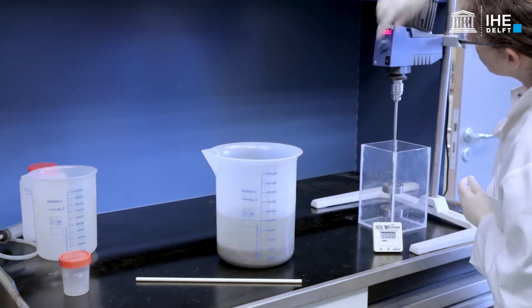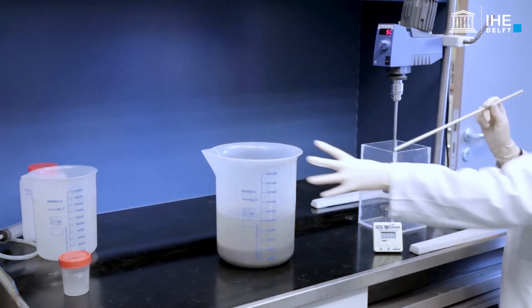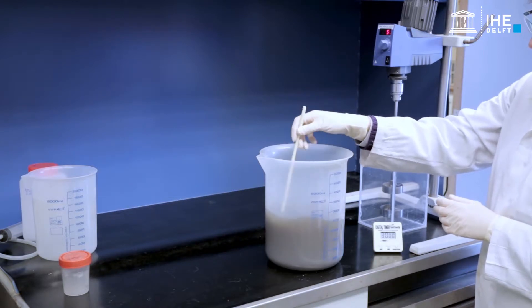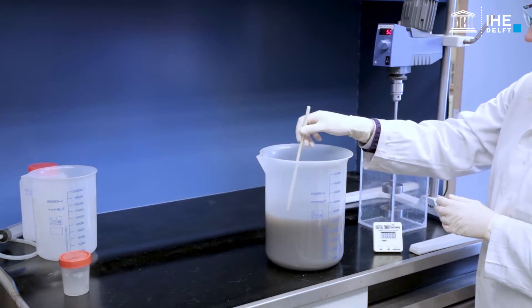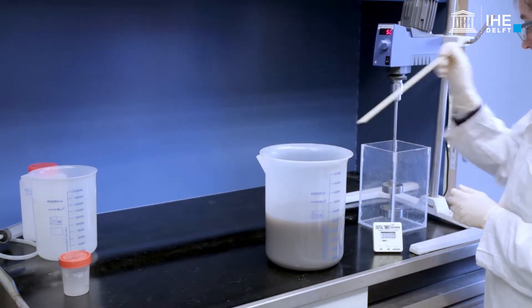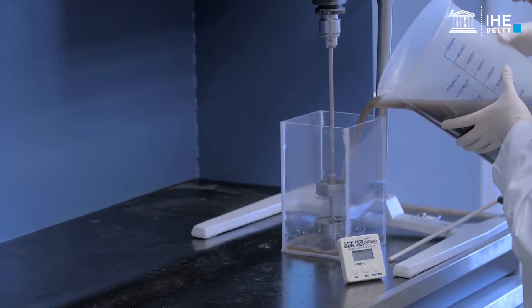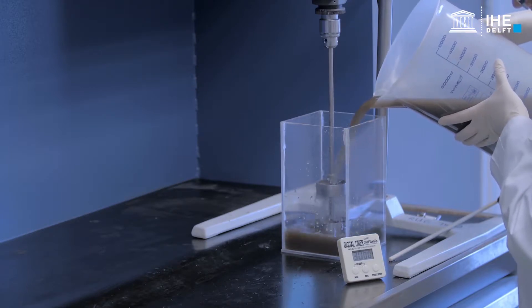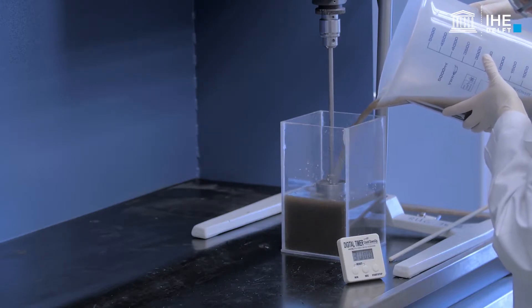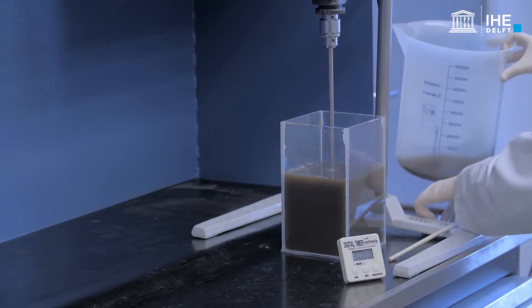Prepare a siphon for supernatant sampling by connecting a tube to a syringe. The activated sludge sample is collected from the activated sludge tank. To start the experiment, stir the sludge sample with a stirring rod and pour it slowly into the flocculation jar. Start the timer.